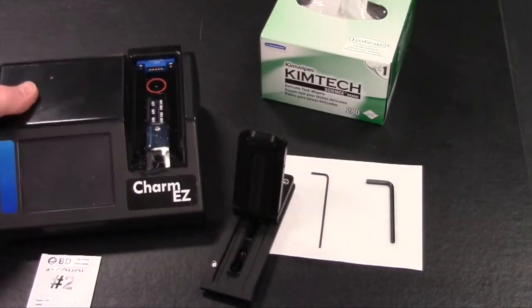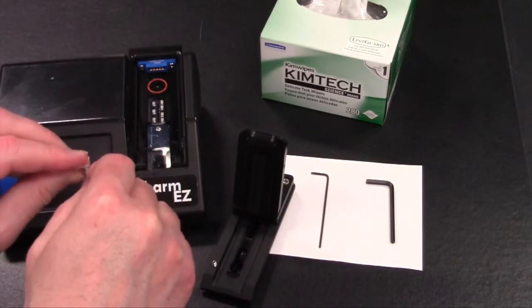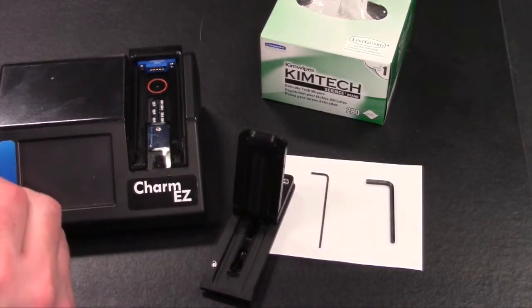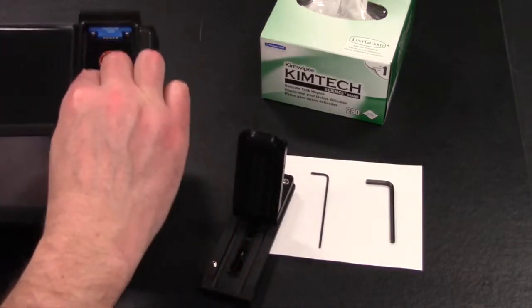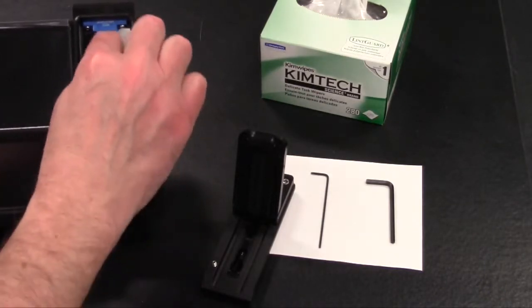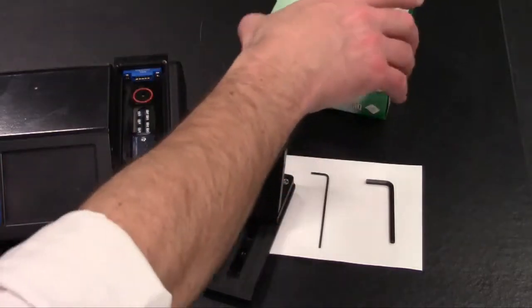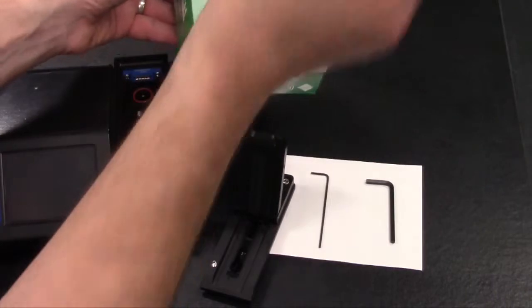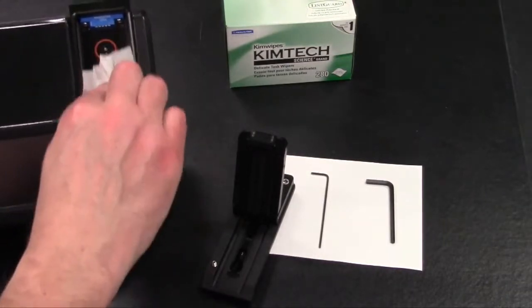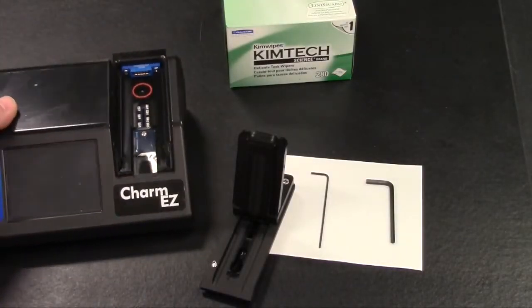Next, what we can do is use the wipe labeled number 2, which is an alcohol based wipe, and also wipe that same area using the alcohol to help remove any contamination that's present. So once you've cleaned that area completely, you want to use a lint-free wipe to dry that residue off. So you can use something like a Kim wipe or other type of cloth that is lint-free. So take the Kim wipe and gently dry the area to remove any residue so that we're not leaving any sort of film in that same area. Once dried, that cleaning is complete.